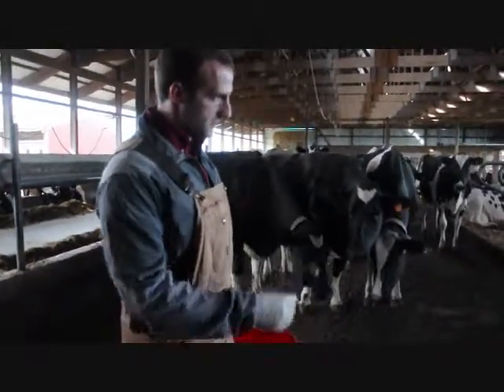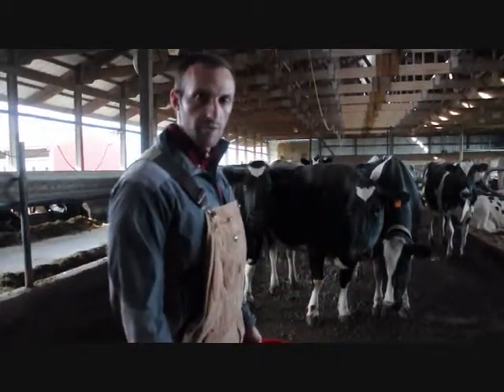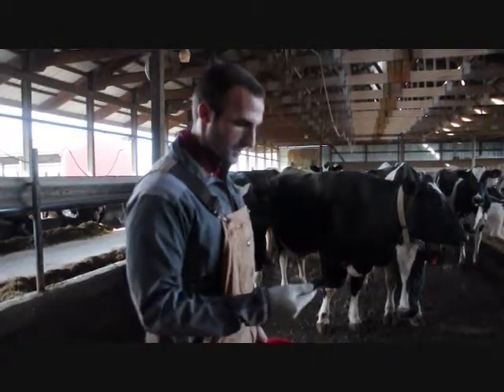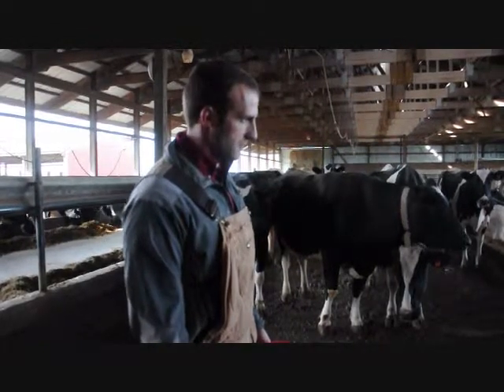We're going to want to stick to pies that are undisturbed if possible. If they are disturbed — cows walk through them — just make sure we brush off any material, whether it be sand bedding or digested solids or anything on the top, and then avoid using your measuring cup to scrape the ground and pick up any additional sand, gravel, or things like that.